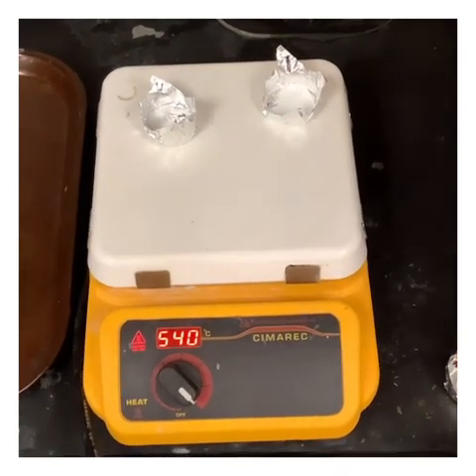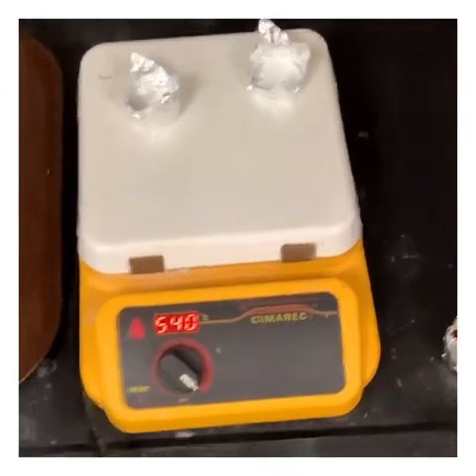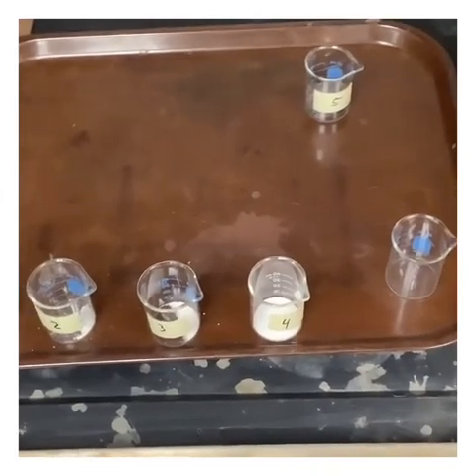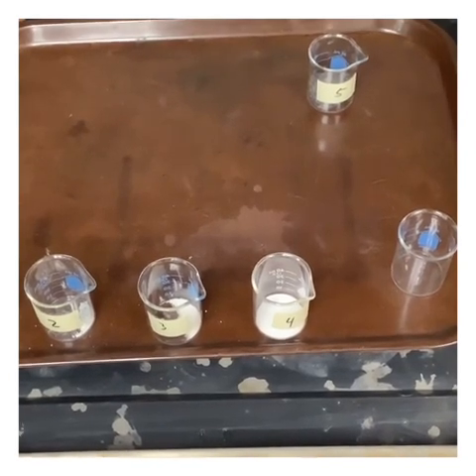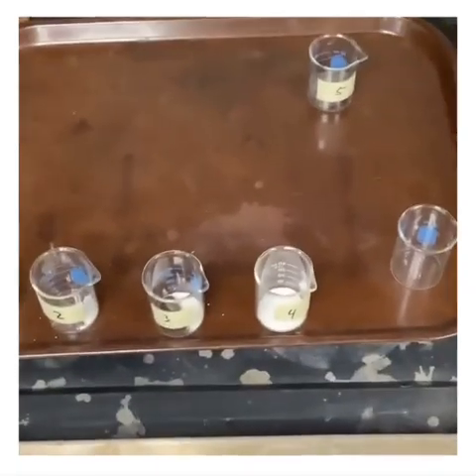At this point, we should have all of our data, and you should be able to identify each one of these crystals as being ionic, covalent, or metallic, and give a little bit of evidence as to why. You should be talking about everything that we saw here in the lab today. Let me know if you guys have any questions.